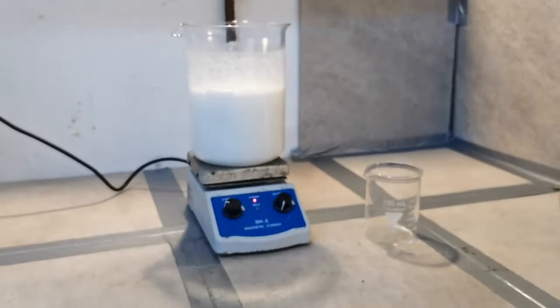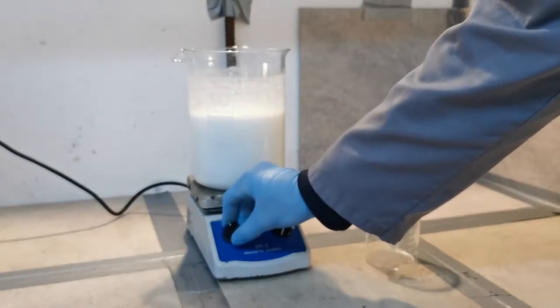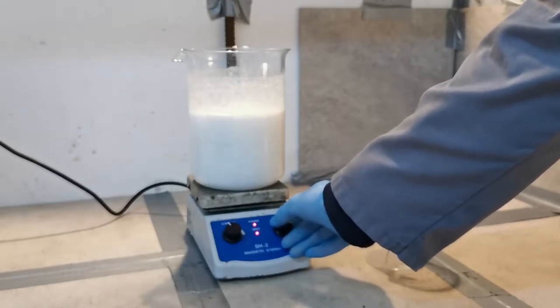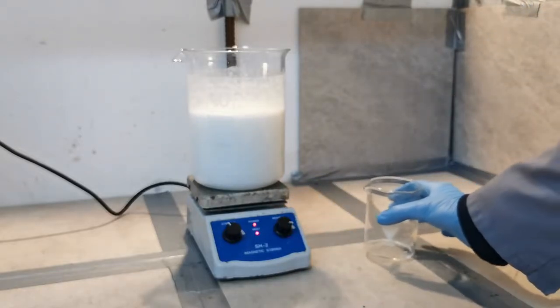Once I reached a pH of about 9, I let the slurry stir under heating for 30 minutes. This will help with the filtration later. Also, any weird globules, where part of the solution is trapped in precipitate, will be able to fully react.